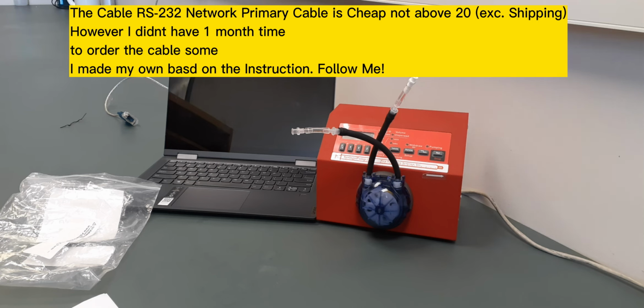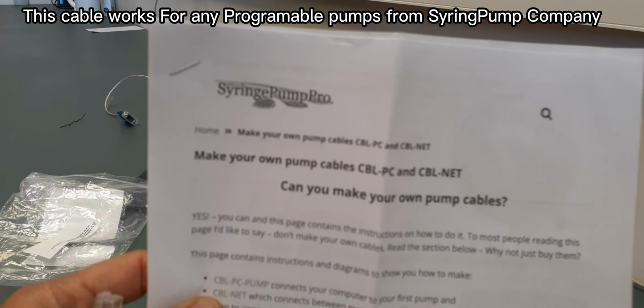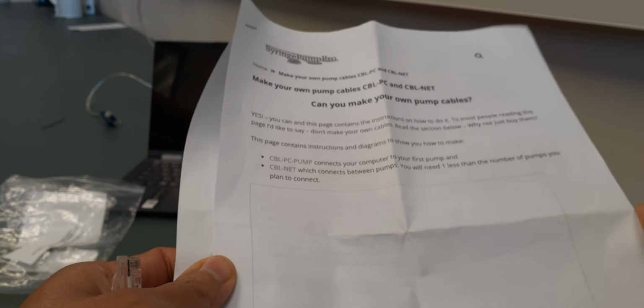Today I'm gonna make my own cable for Syringe Pump Pro. I have the new Era 9000 version, and there is a document that you can follow, and it says how you can make your own pump cable. So I followed this and I got all the cables I need, the pieces.